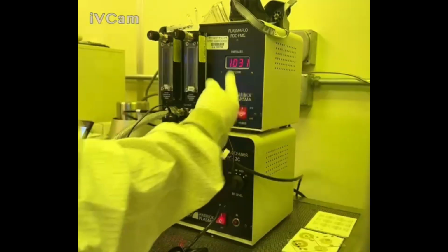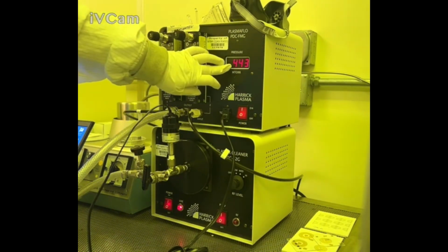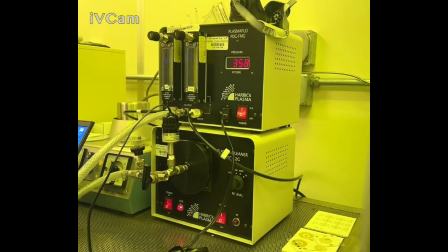you should actually turn this on before you start anything else as well. Make sure that this is on. You're going to wait until this says 150 or close to 150 millitorr. That tells you that that chamber has been vacuumed out enough for you to start the process.